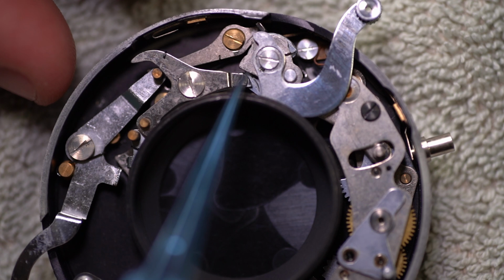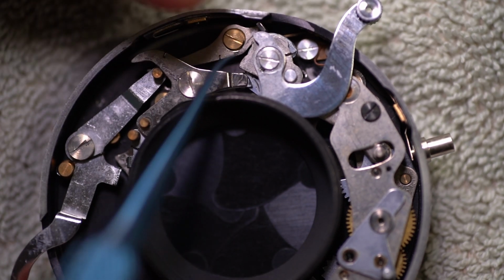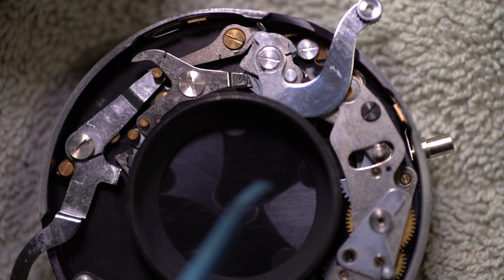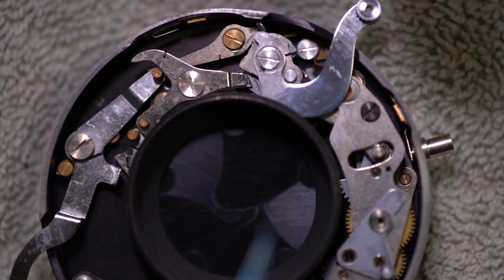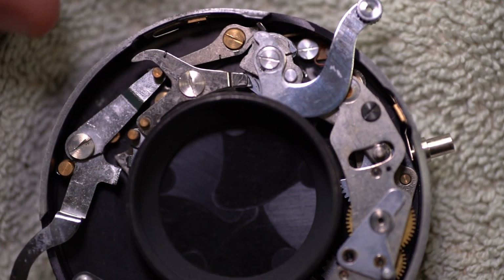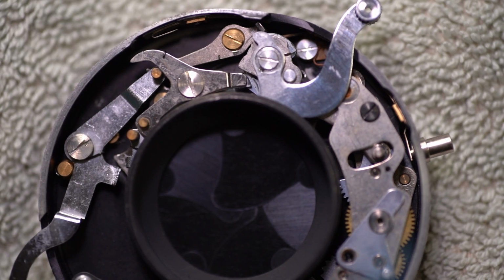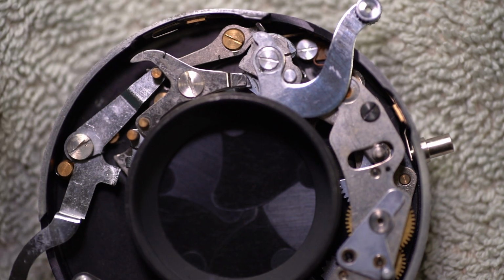I think this is the part that actuates the opening of the iris shutter, and that is what actuates the closing of it. And the whole idea with this is it closes and is light tight. You have your film camera above, the shutter is locked open, also with a cable release, and then you actuate your microscope adapter. This one is called a PFM, and that's what this whole adapter thing with this shutter system is called. But anyway, you do that. This opens up, lets light into the film of your camera, and that's what takes the picture, and then it closes back up.